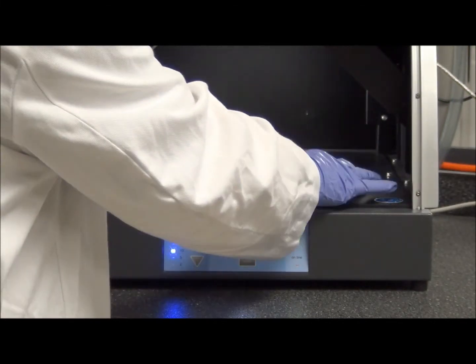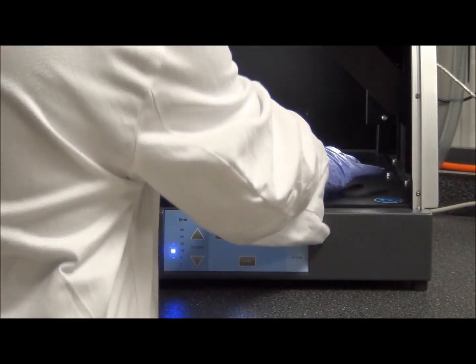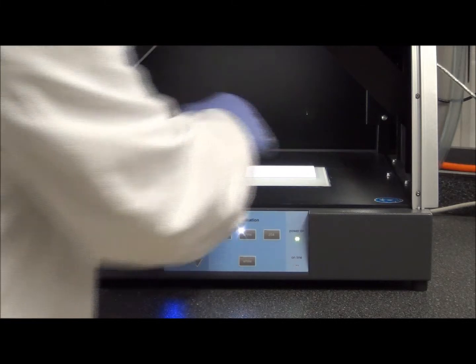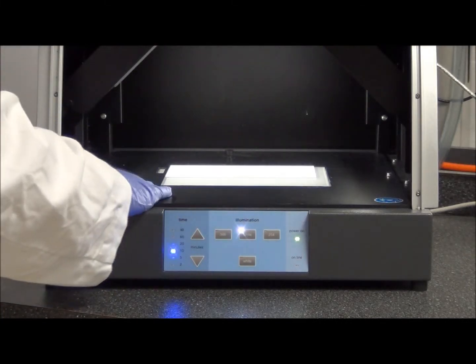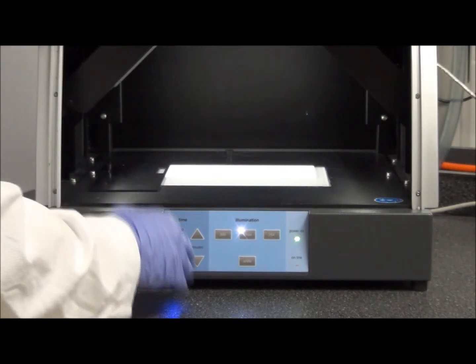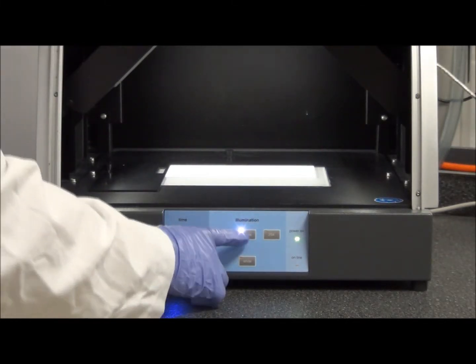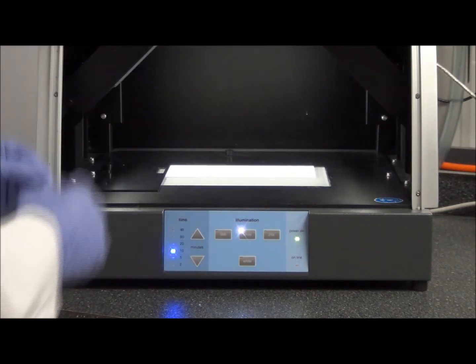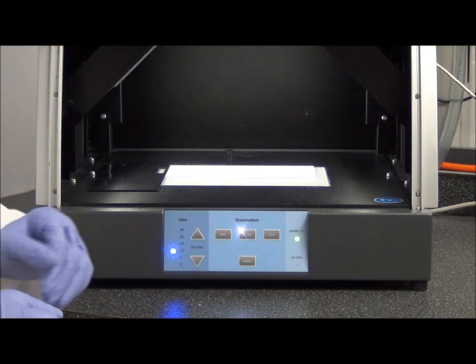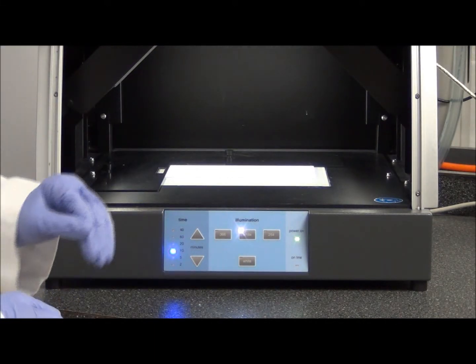Again, we just put the plate inside the visualizer, slide it to the back in the positioning device, and I turn on the white light manually just so you can see inside, but normally you don't need to turn any lamps on.